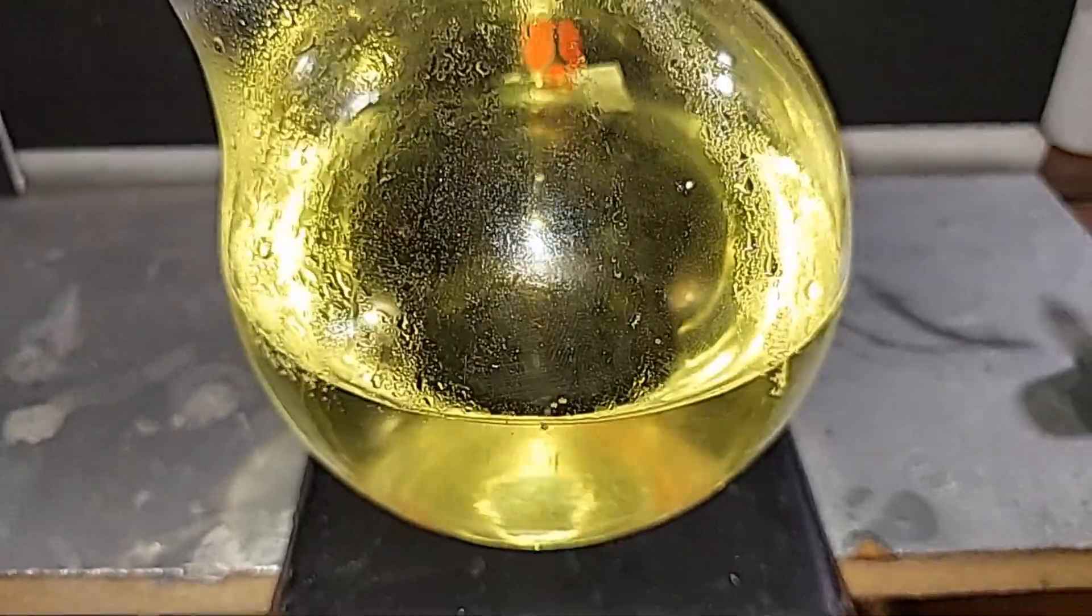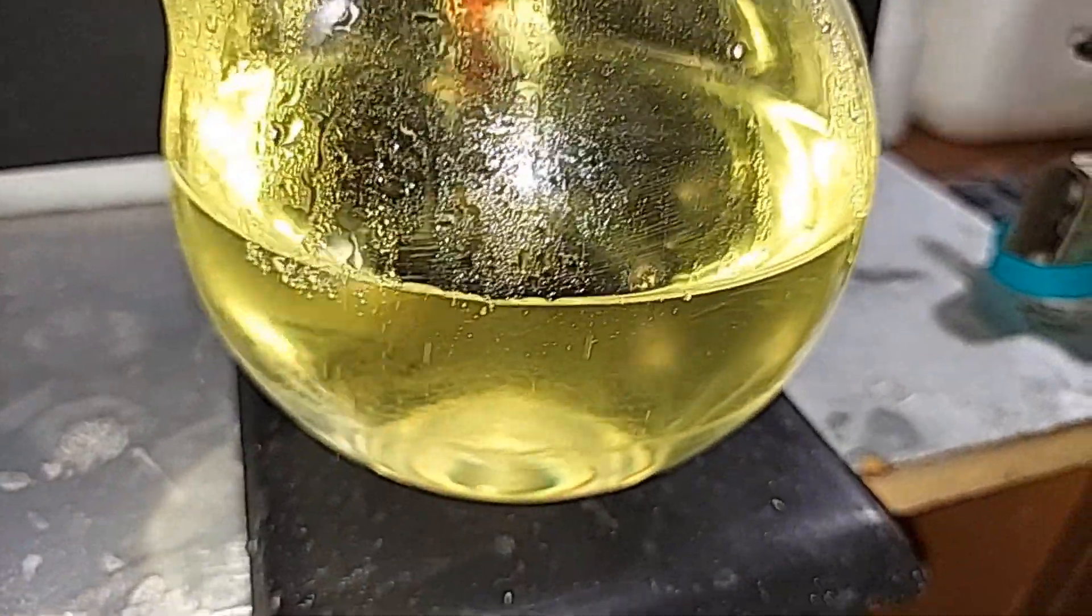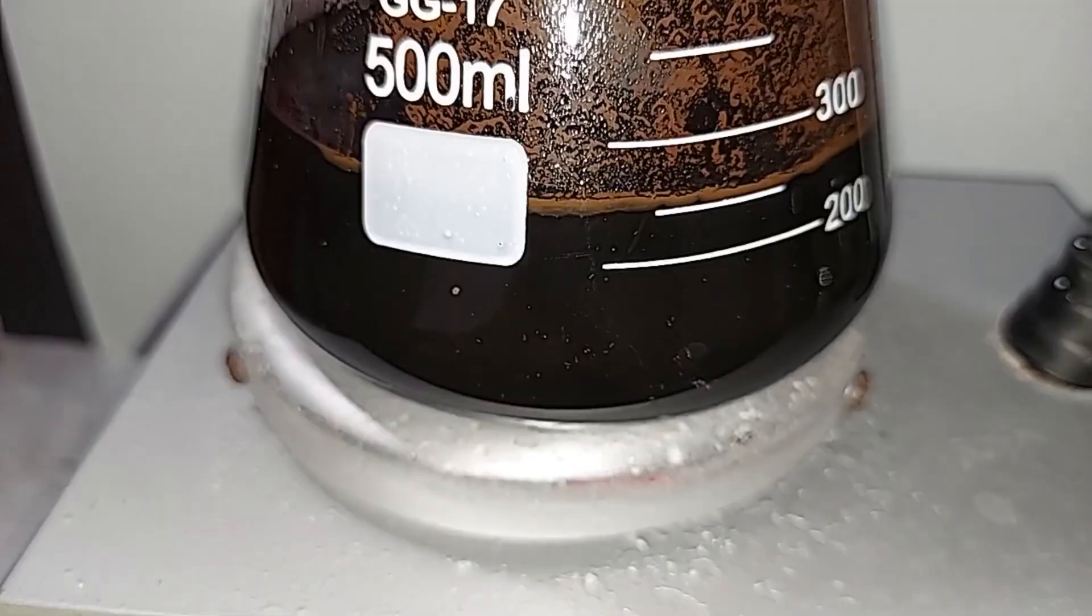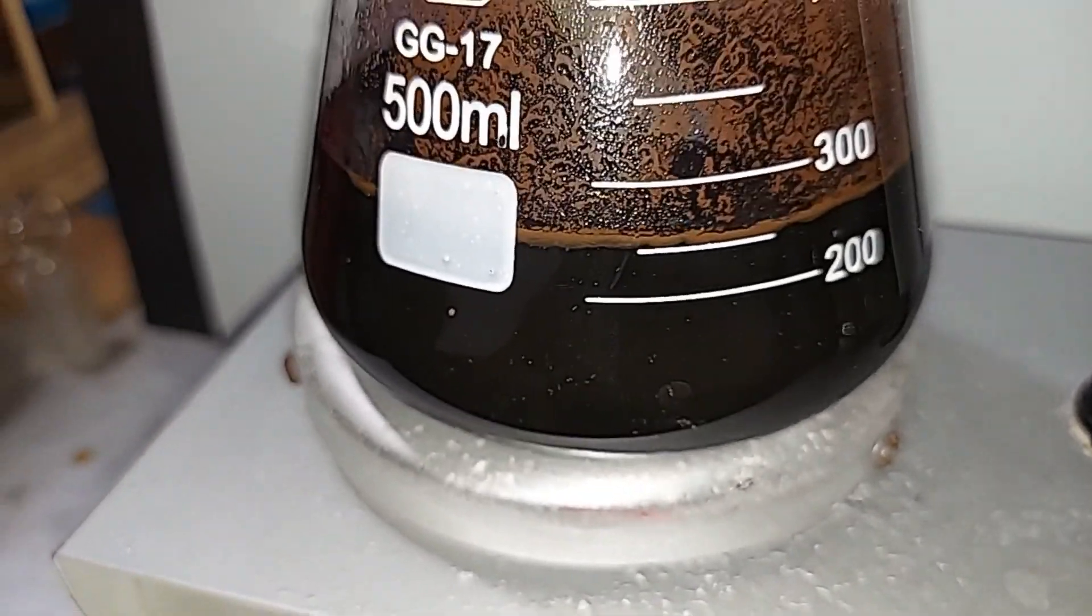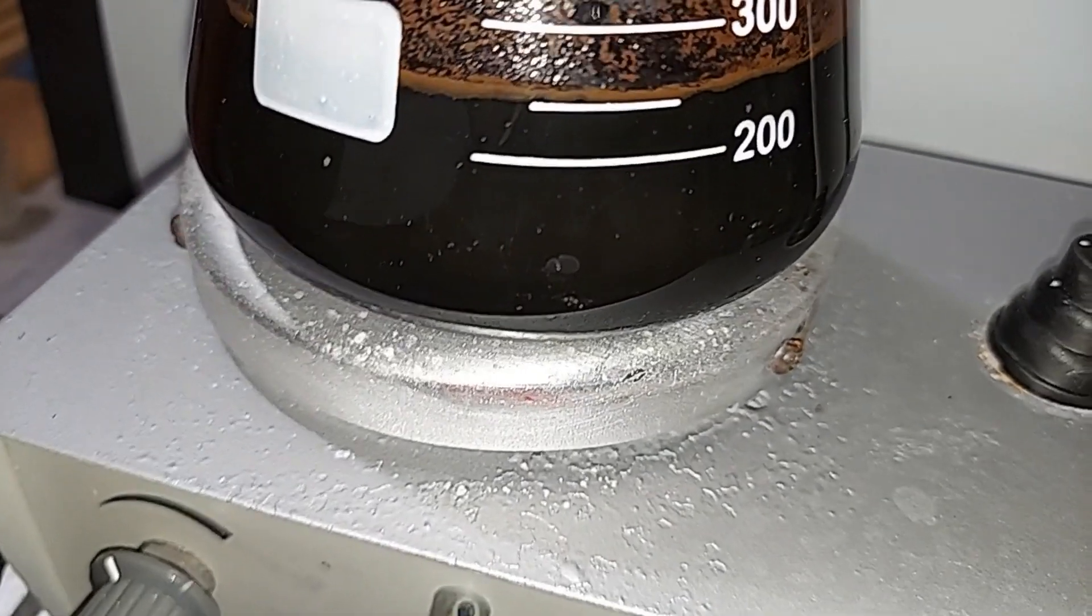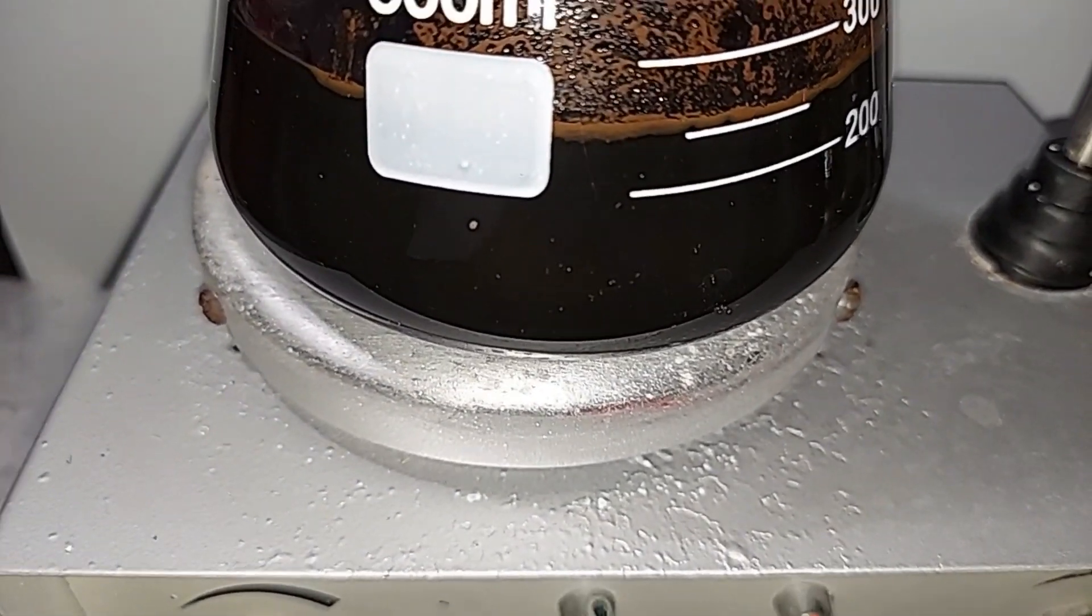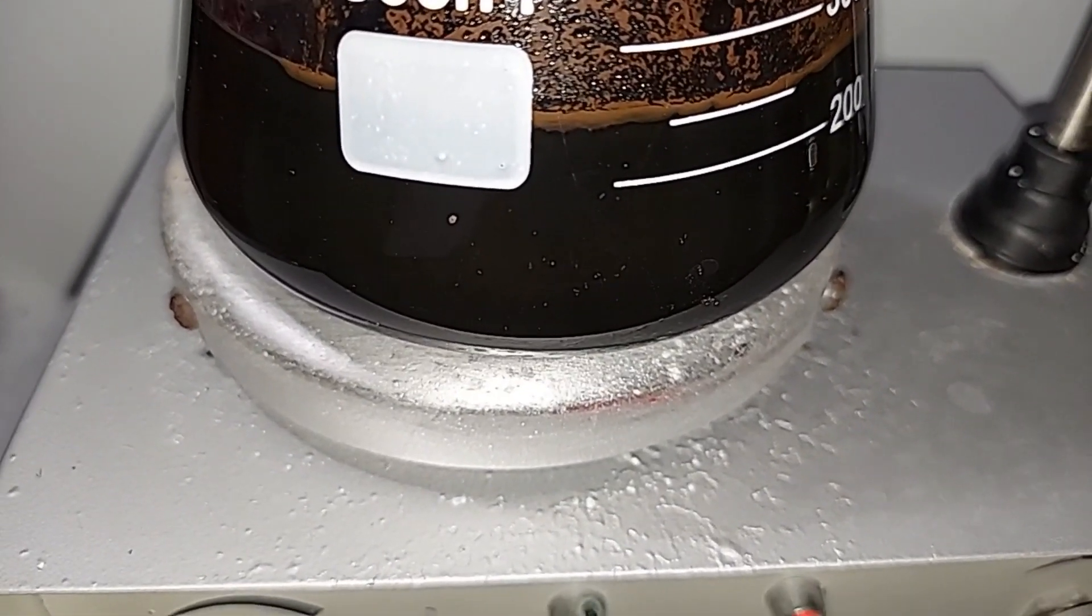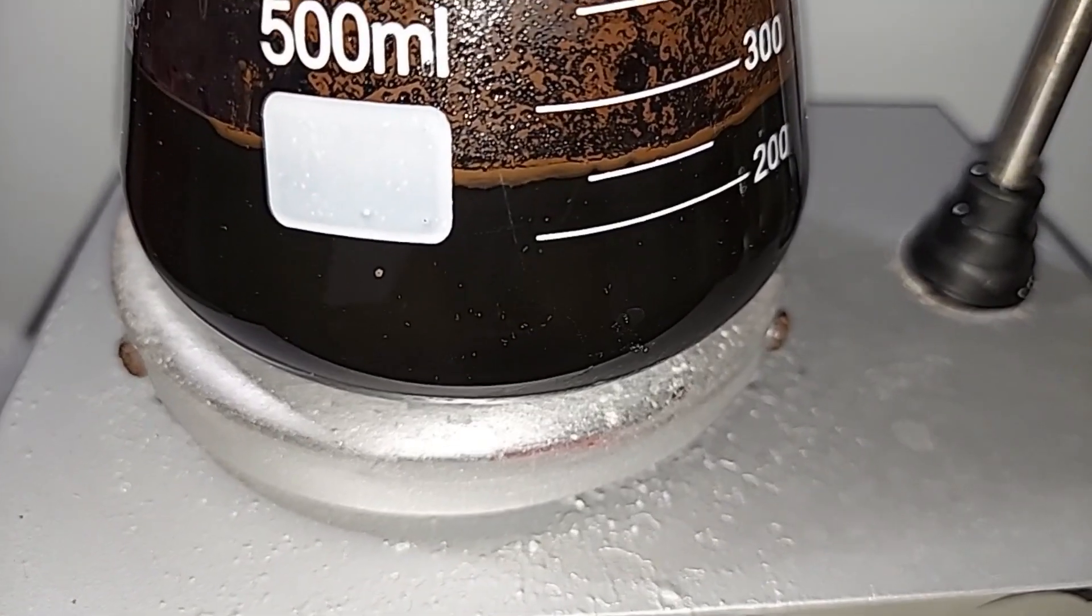It's been 40 minutes. I plan on running this for an hour. Just nice to see that the chlorine gas is still being produced. It's been 45 minutes, and you can clearly see the change from a greenish color on the bottom to a dark purple, almost black color, which is what we would expect when chlorine oxidizes the potassium manganate and produces our potassium permanganate.